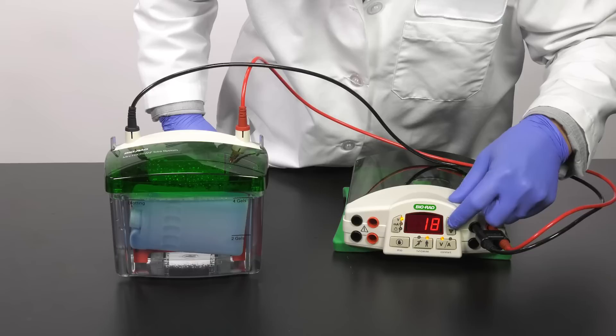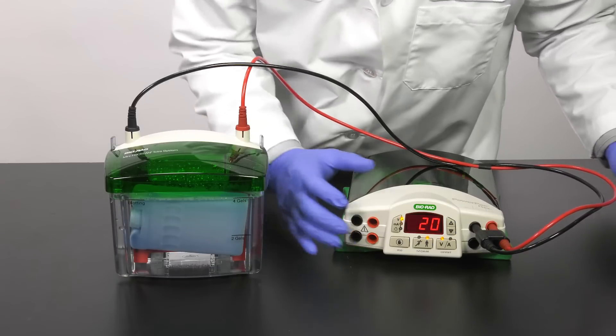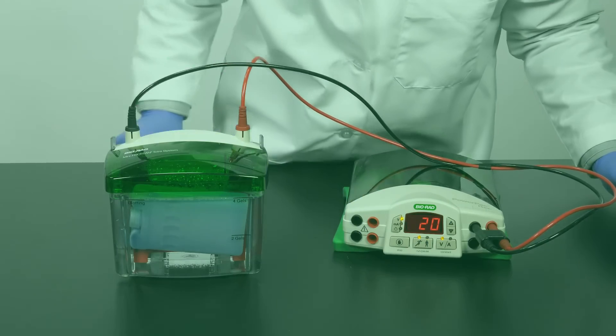Set the power supply to appropriate settings, then begin transfer.